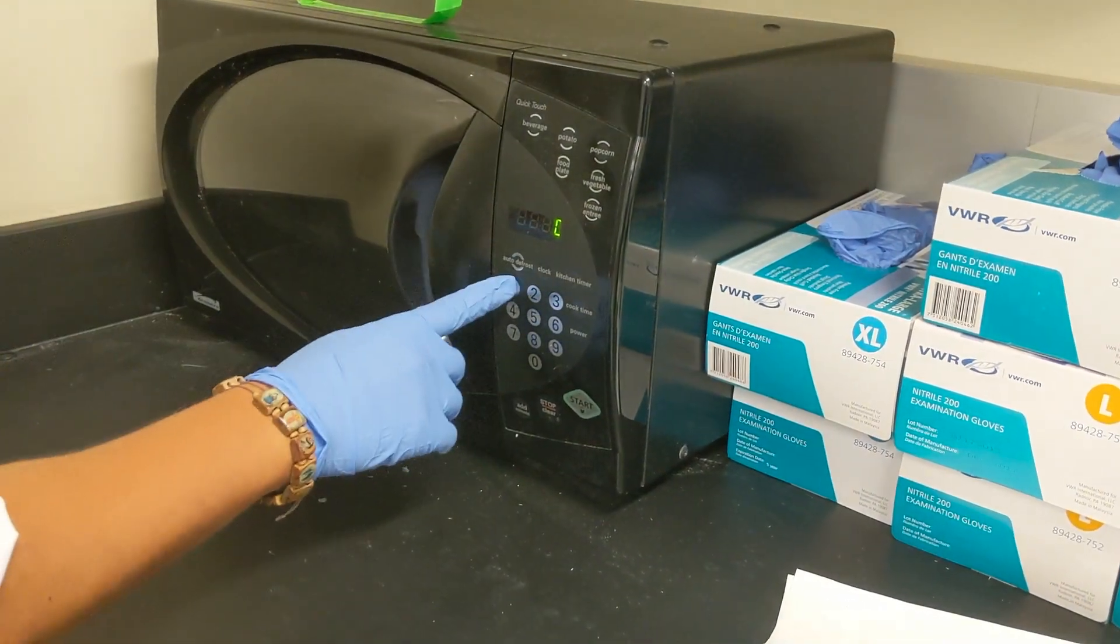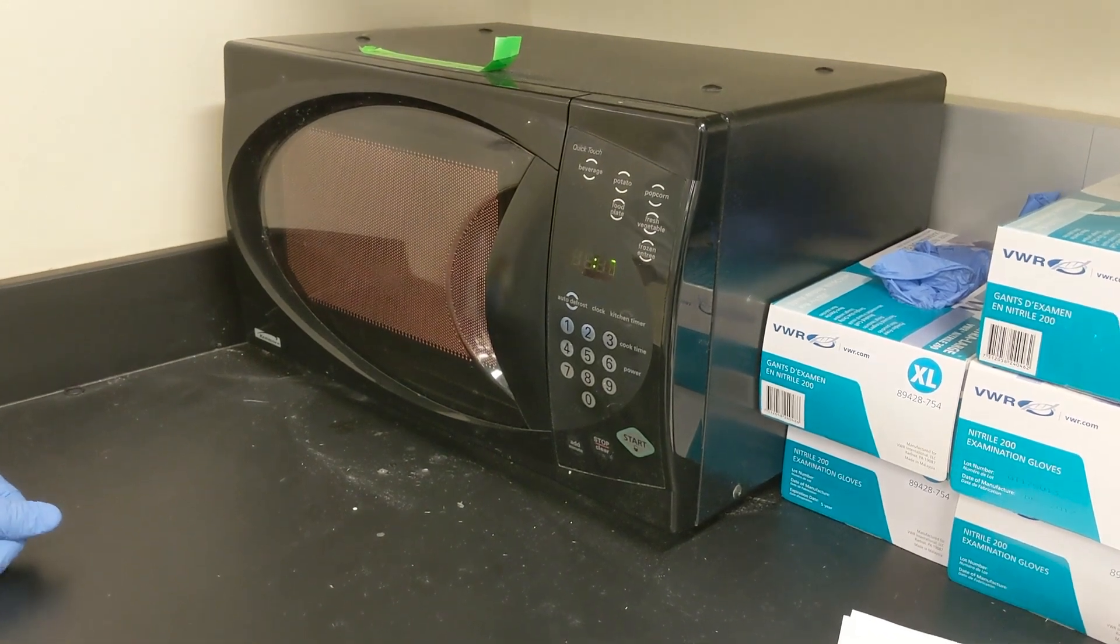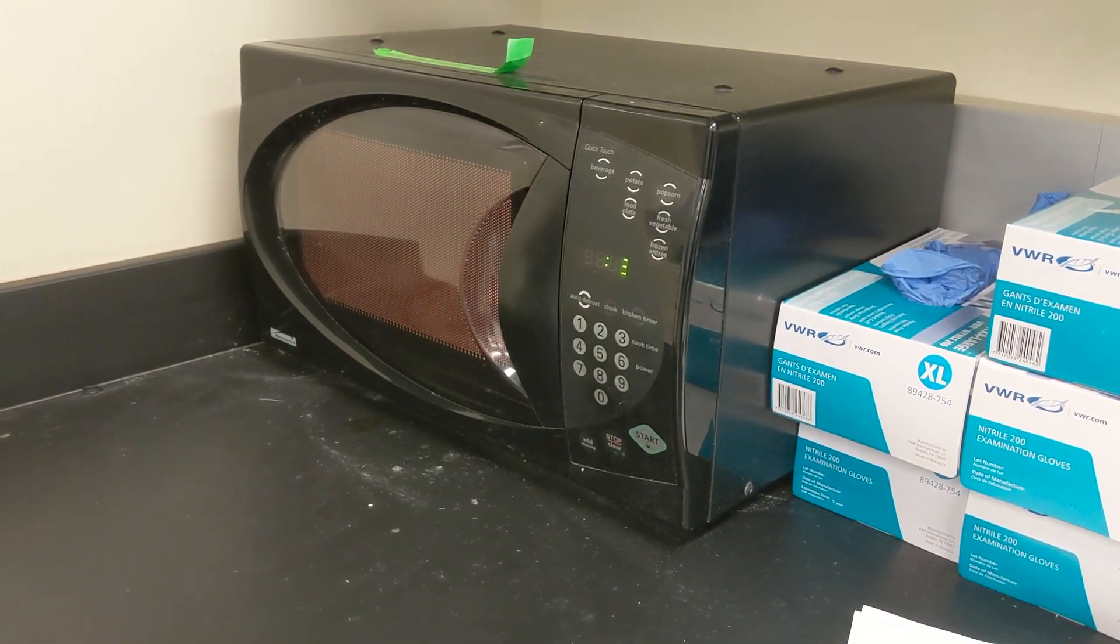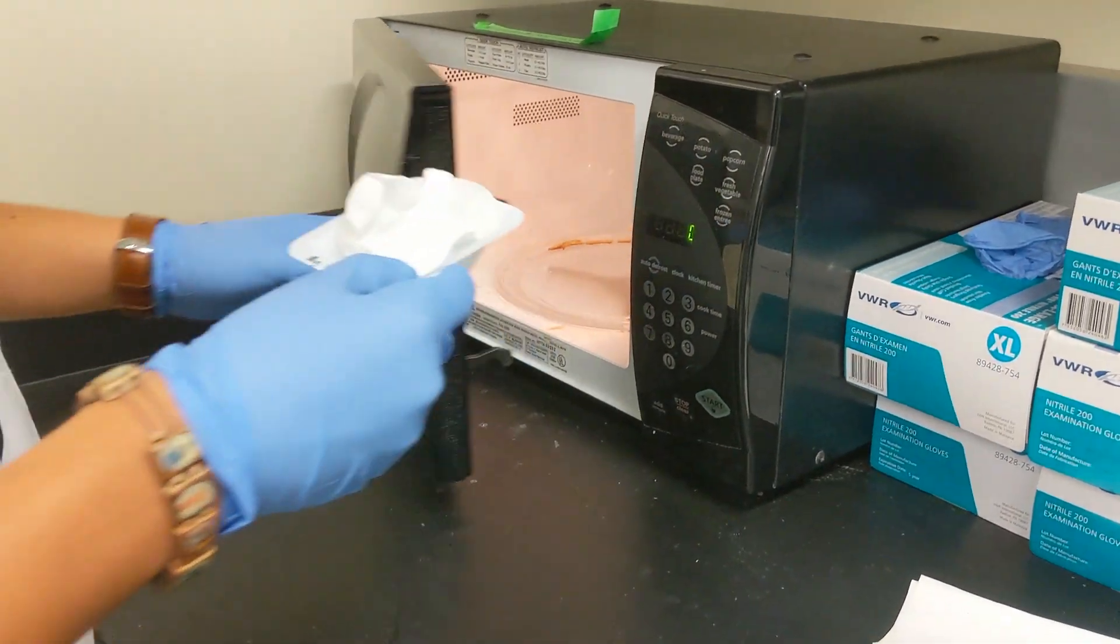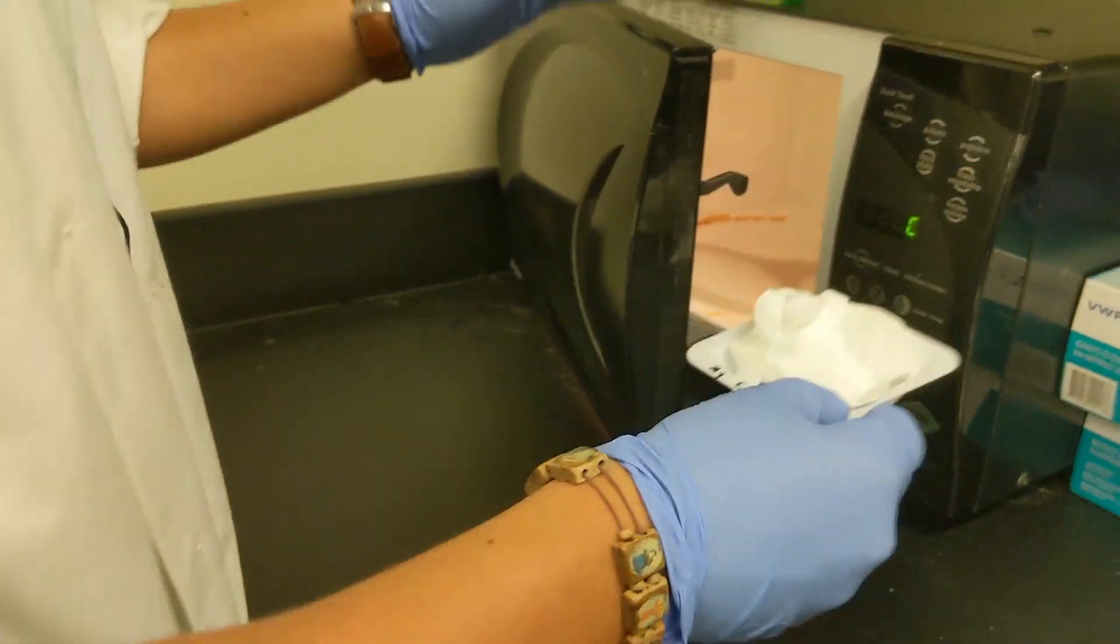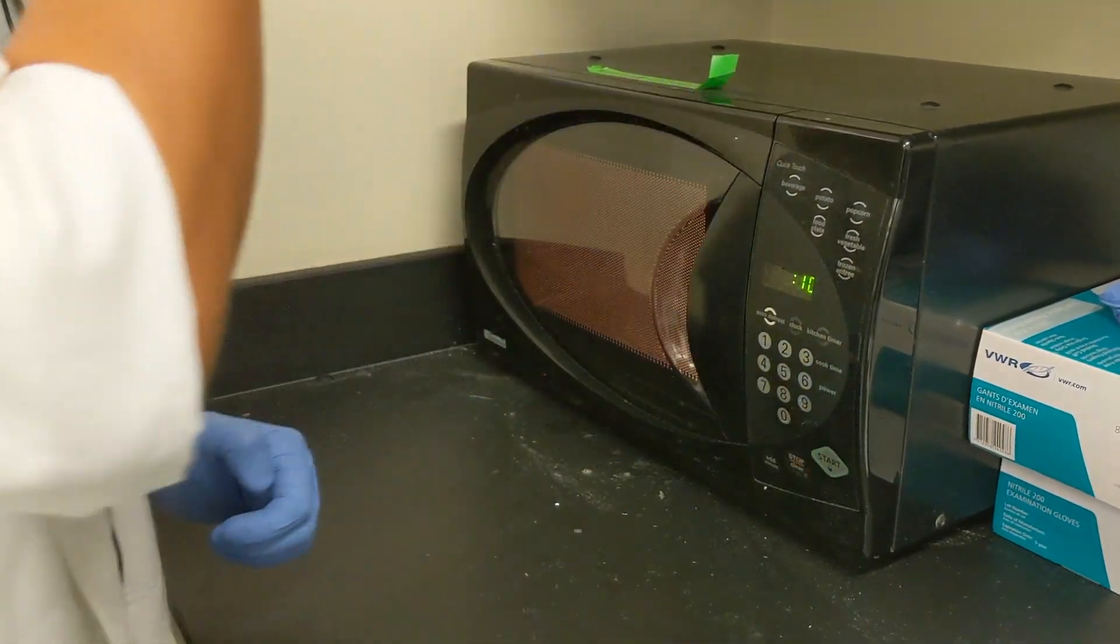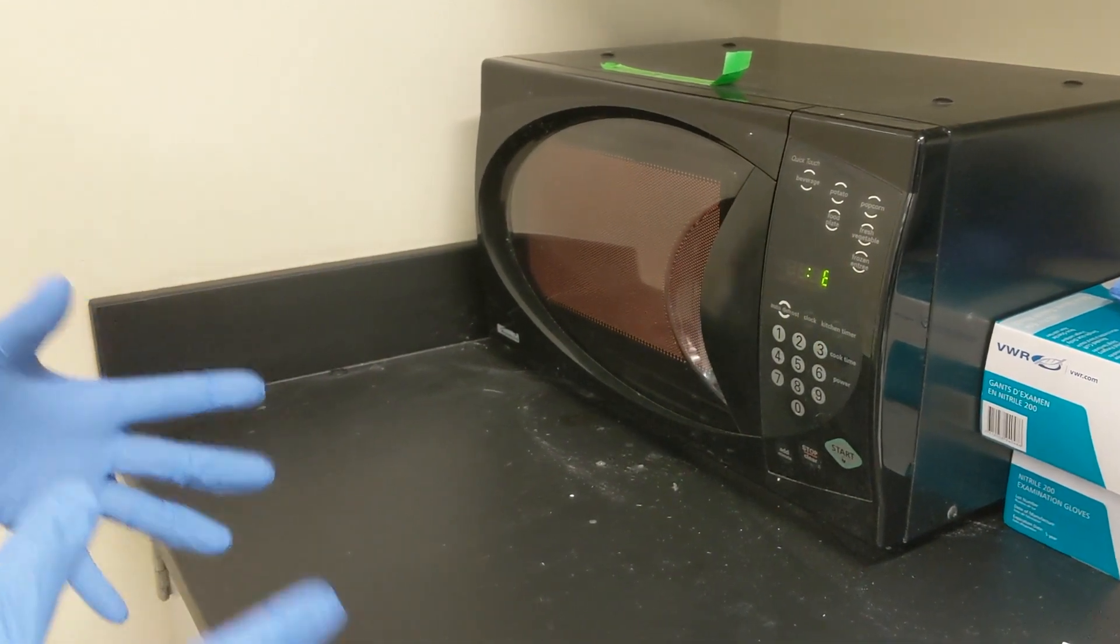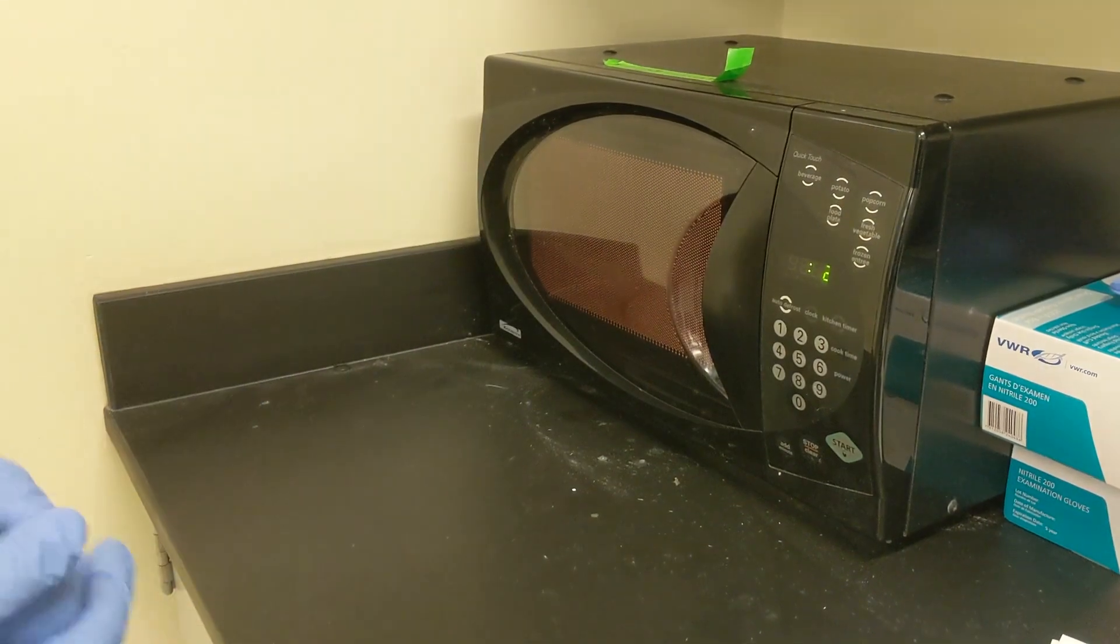We'll put it for about 10 seconds. And this is going to start the process of drying the precipitant really well. We're going to remove all of that water. So it's done. We'll see how it looks. It's still obviously wet. And so we're just going to keep doing it 10 seconds at a time. Because if we go any more than that then we have this situation where we might cause the precipitant to pop out and then we lose some precipitant. So we don't want that.